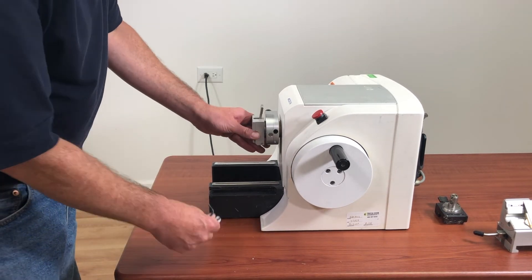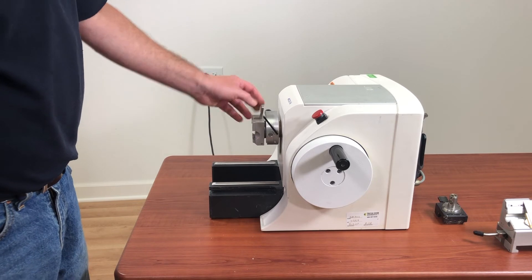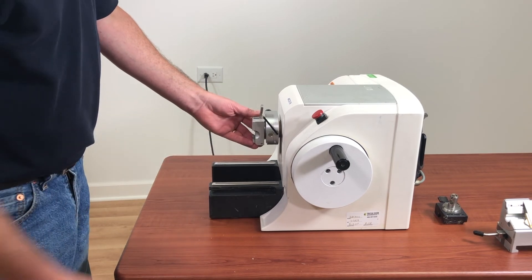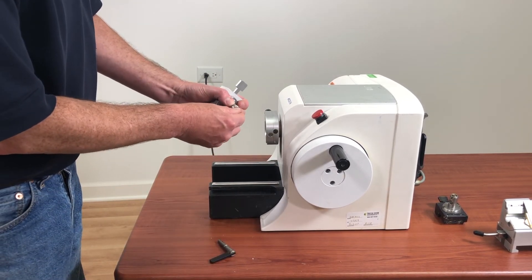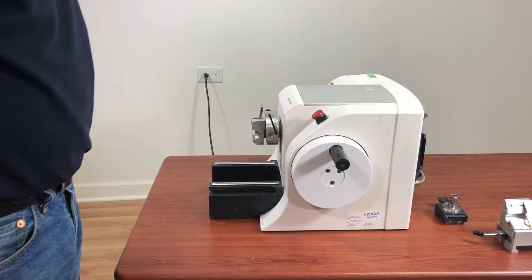In this case, I've actually adjusted the screw too far in, and the lock is only going that far. Now you can certainly still cut like this, but if you want to turn your head, this is going to be in the way. So just be aware of that. All you have to do to fix that is remove it and loosen it back about a 16th of a turn. Reinstall it again, and that should be fine.